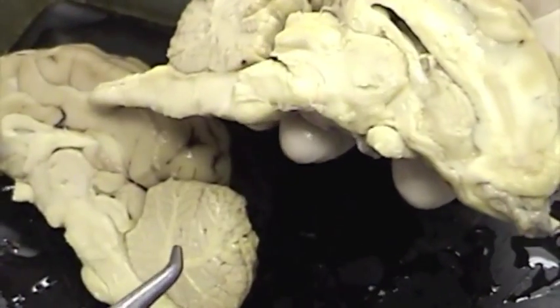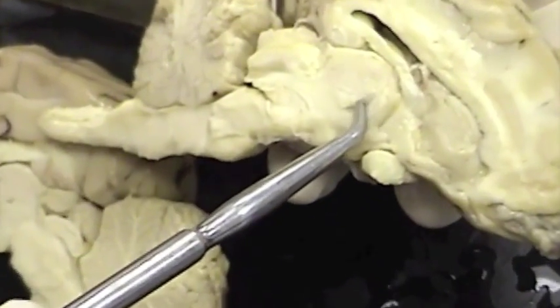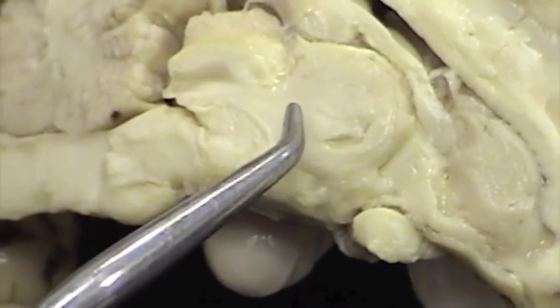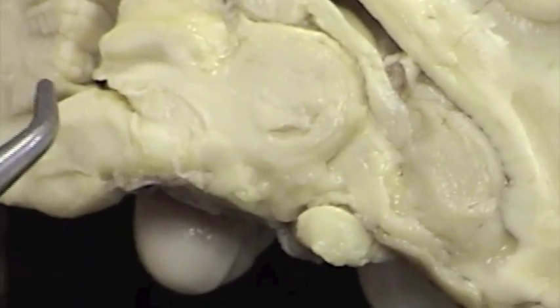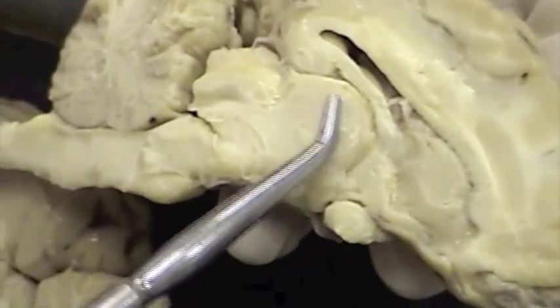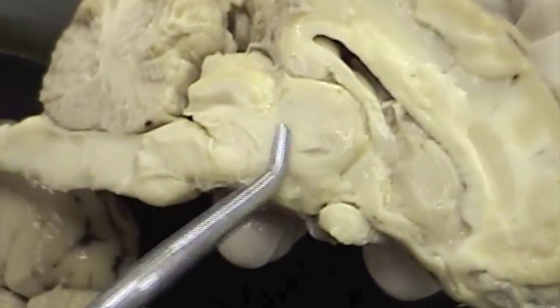The intermediate mass is in this region right here. I can slip my pointer around it like that, but I won't ask that on the practical because it's too difficult to see on the sheep brain. It is in this region right around the intermediate mass that we find the third ventricle, so the third ventricle would be right there.